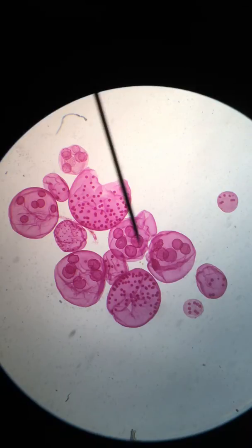In this short video clip, I'm going to give you a preview of one of the organisms you will see in our lab. This is Volvox. Volvox is an example of green algae. It's a chlorophyte. You may be noticing very quickly that these are in no way green. They have been stained, and they are dead. But when you see them live in the lab, they will of course be beautifully green, and I bet you can guess which organelle is responsible for that.